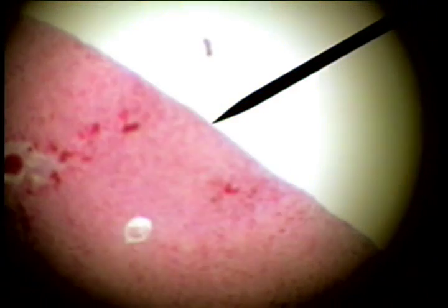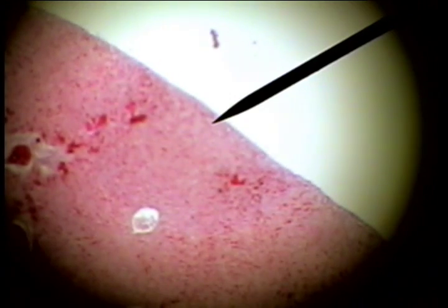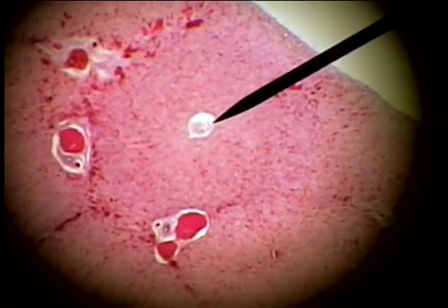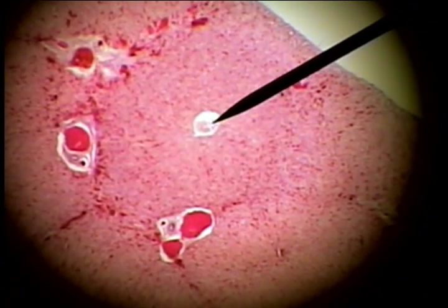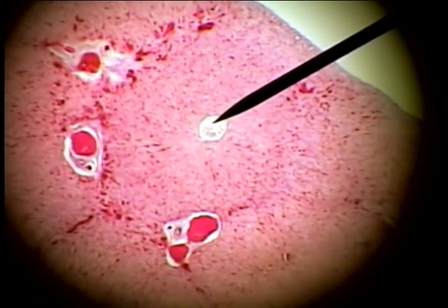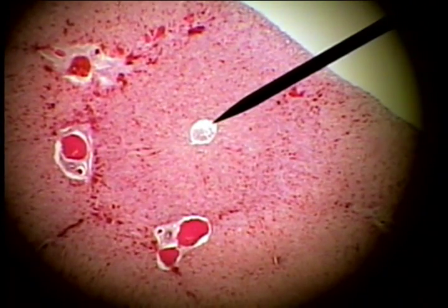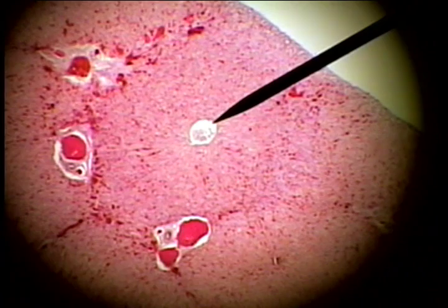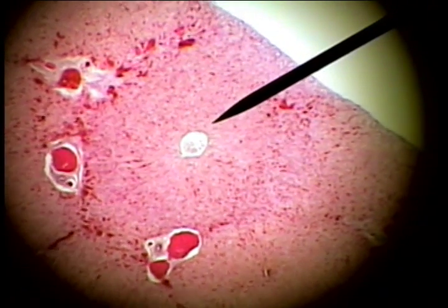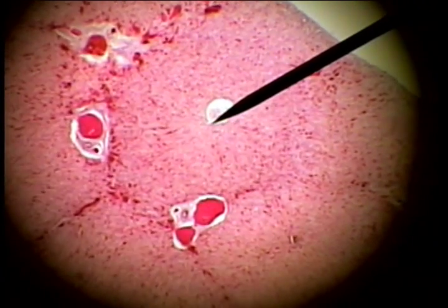Going back to a lower power, we see that the liver has lobules, and these lobules are characterized by a central vein. Radiating out from the central vein are the liver cords, and these are made of a line of hepatocytes, or liver cells.